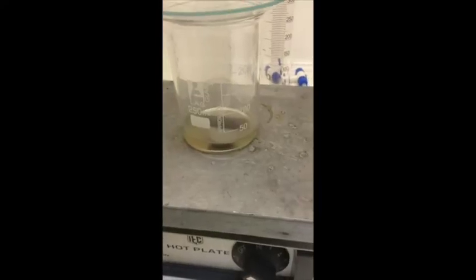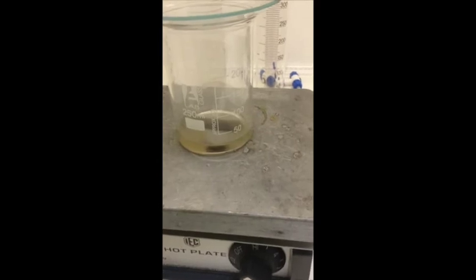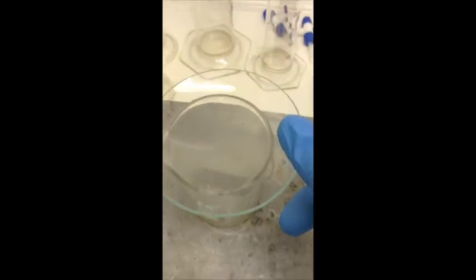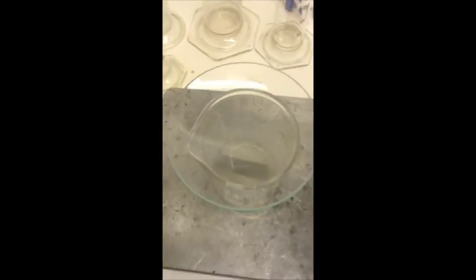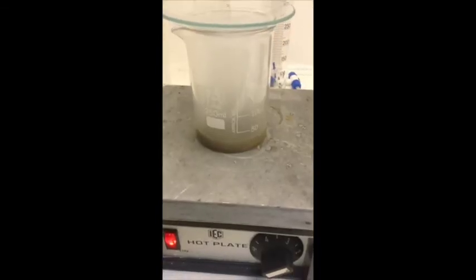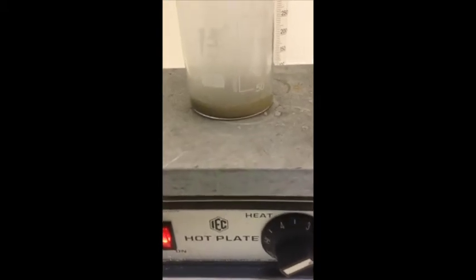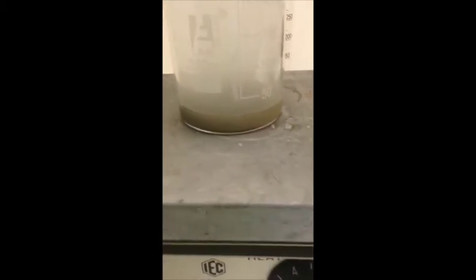The hot plate will allow the copper to react with hot concentrated sulfuric acid. This is evidenced by the fumes being given off. You can see now that the reaction is progressing reasonably quickly.